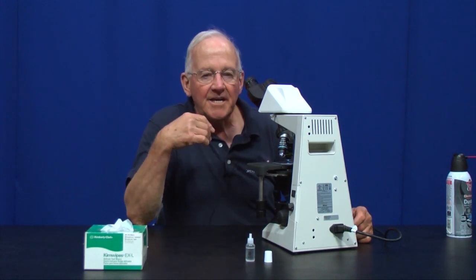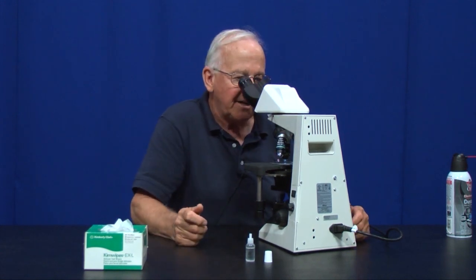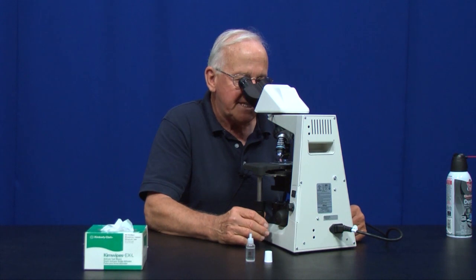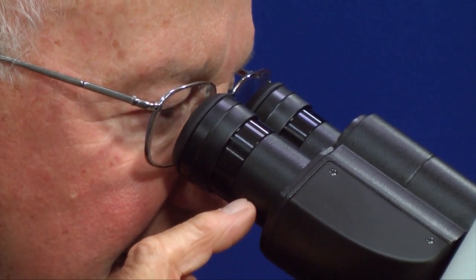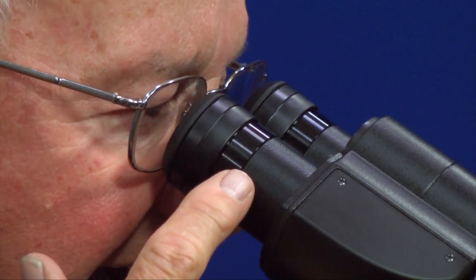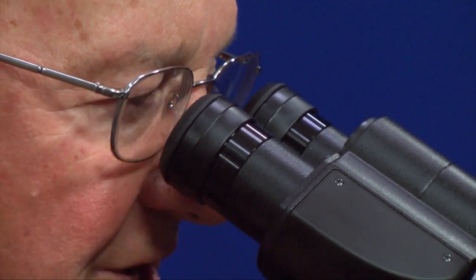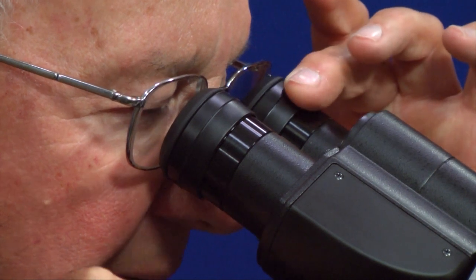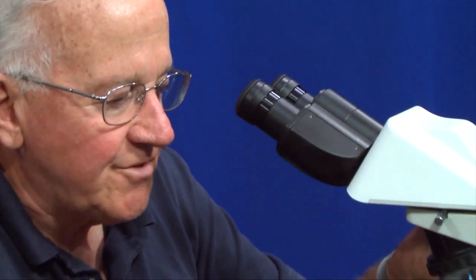If you're not wearing your glasses and you're nearsighted or farsighted in one of your eyes, you will not be able to leave both eye tubes exactly at that line. The proper way to do this would be to, at the 10x objective, focus on something in the center of the field of view using your right eye, which is set at that line. Then, trying not to close that eye but looking predominantly with the left eye, bring that eye into focus like you have with the right one. So now you have one eyepiece that is set at that line, and the other one may be set just a little bit off if you're nearsighted or farsighted.